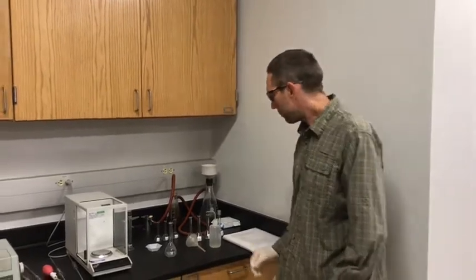Hello everyone. This week's lab is Molarity and Dilutions of Solutions. Hopefully you've read the background material. I'm going to go through the experimental procedure now.